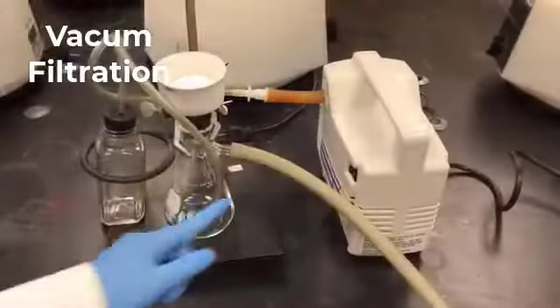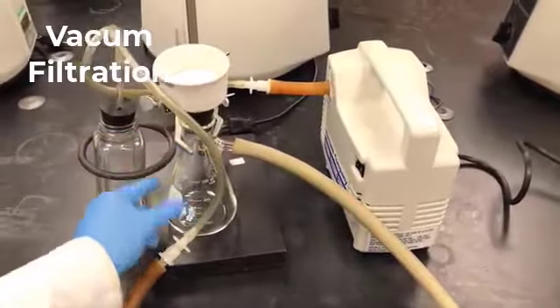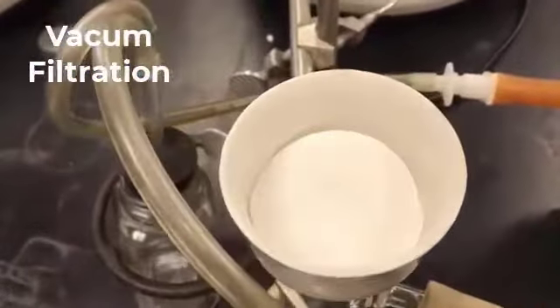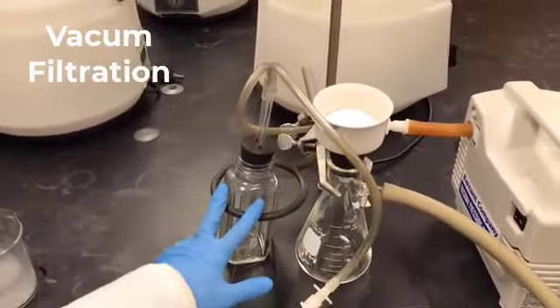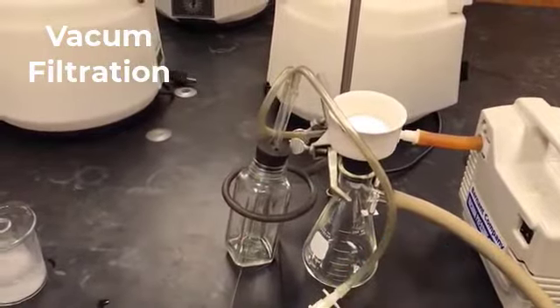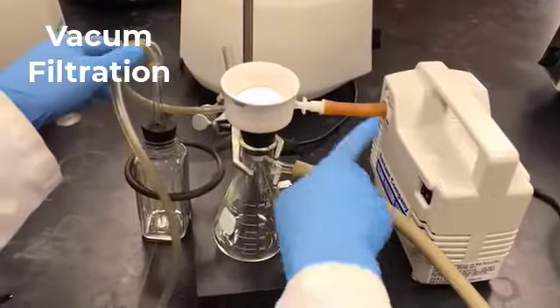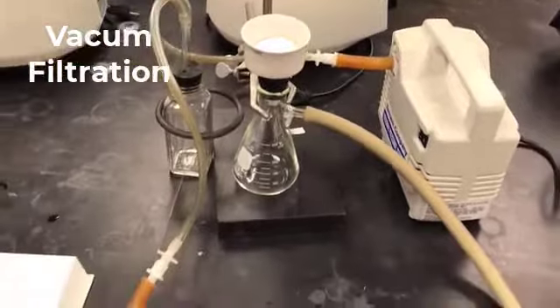So this is the setup for the vacuum filtration. This is the vacuum pump. That's the filtration flask. That's the Buchner funnel, and I have already added the Whatman filter paper. And this is the trap. The trap is needed so that the filtrate does not go into the vacuum pump and damage it. So it's very important to have the trap. And you can see the connections right there. It should be connected this way.